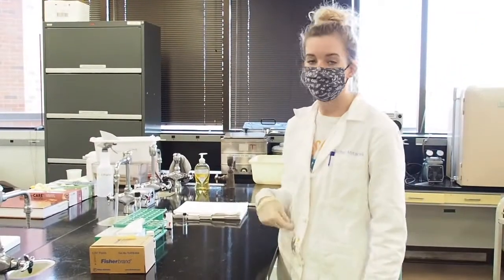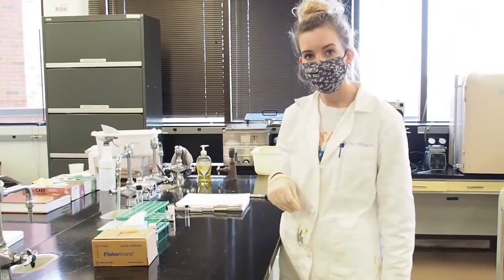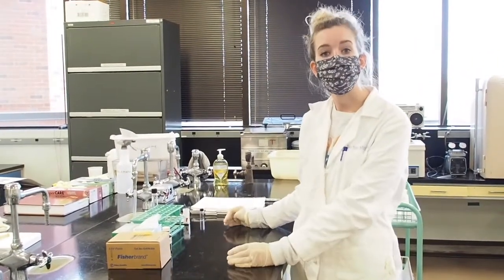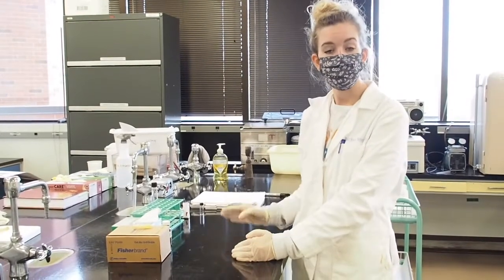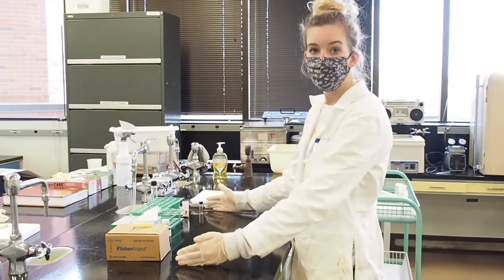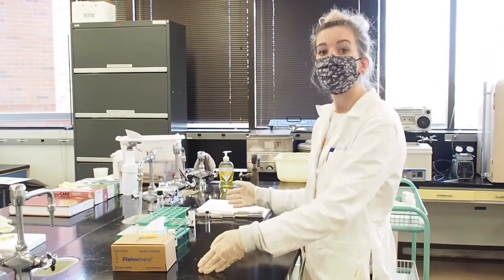Rachel, I'm your TA, and I'm going to walk you through the sample prep for the GC lab. So when you first come in, you're going to get ready like you usually do for lab, and each of you will have your own station. You'll be working within your groups, and each of you will be doing one rep of one oil for each analysis, but you will all have your own individual stations with everything you need to do the sample prep.